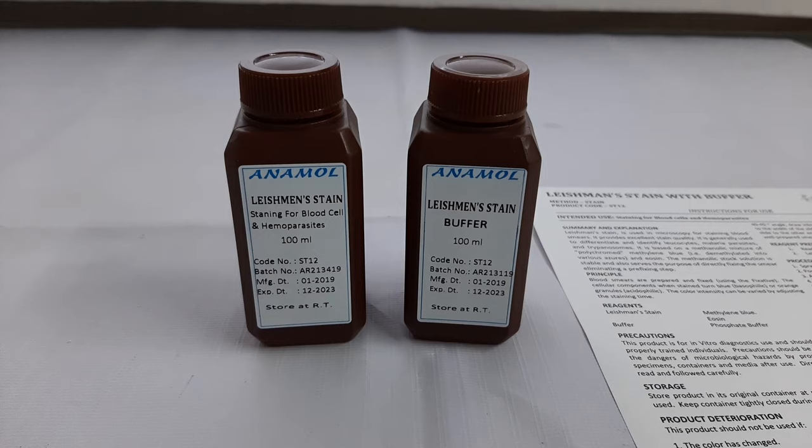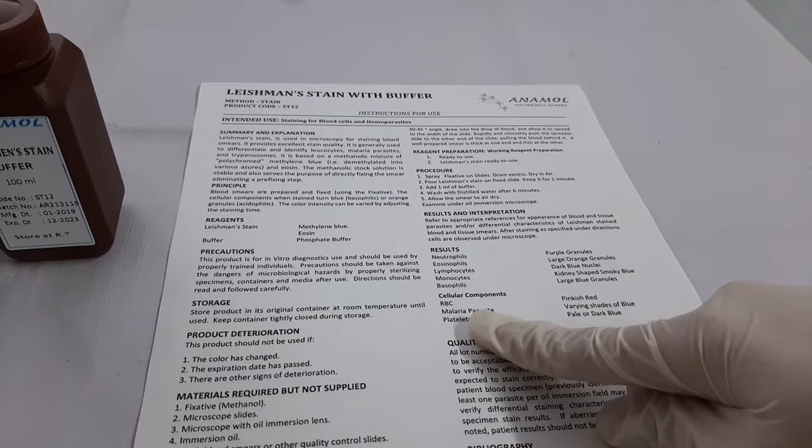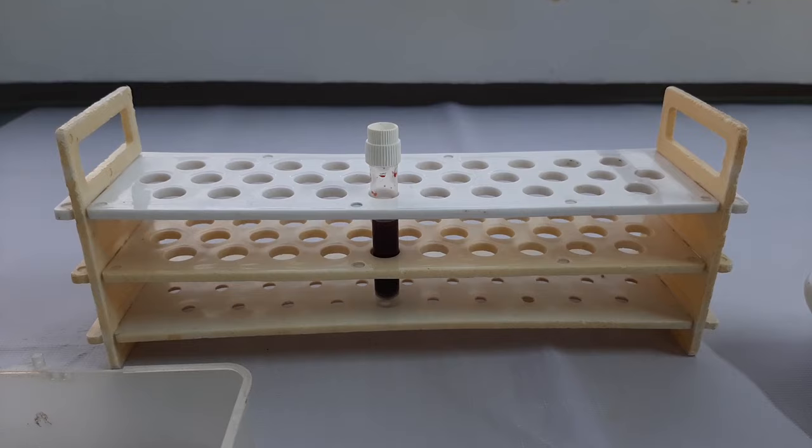First, let's have a look at the kit components. The kit contains one bottle of Leishman stain, one bottle of Leishman buffer, and the instructions for use. We recommend all users to read the instructions for use thoroughly before using the test.